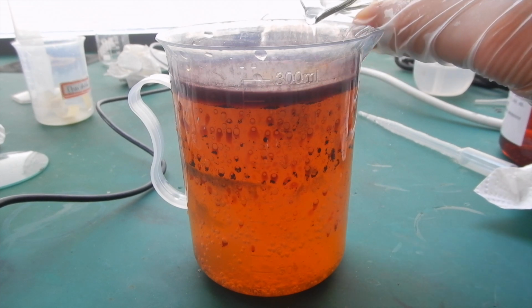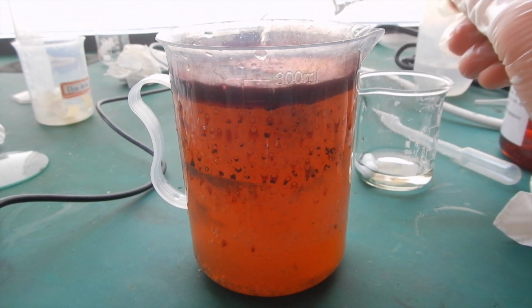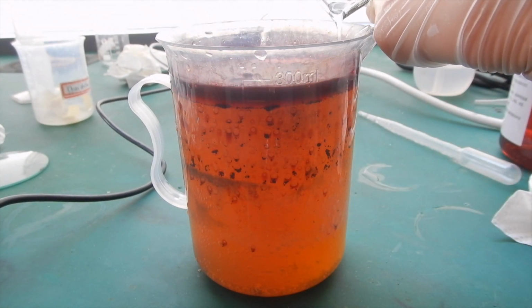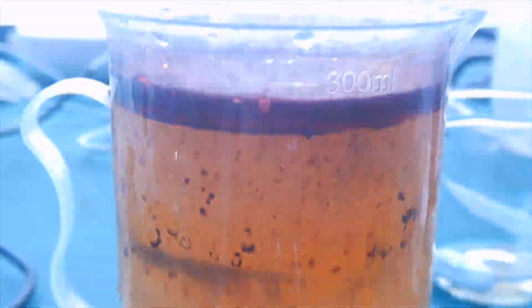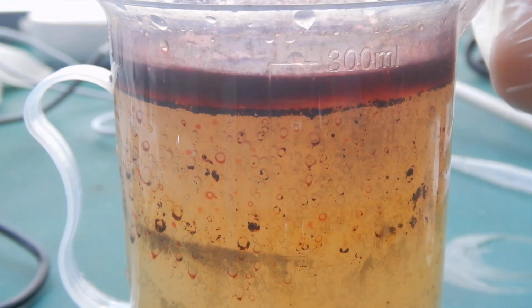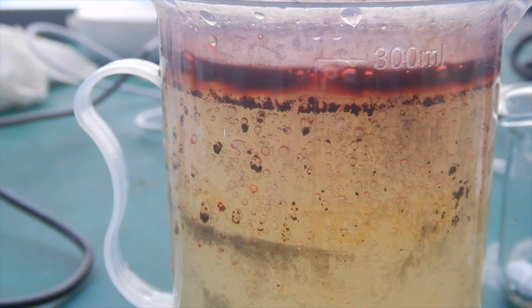After all the potassium carbonate is added in, the color of the solution darkened. I did not expect this at all, because the potassium carbonate is supposed to remove the remaining iodine colors and turn the solution colorless. However, when the solution is stirred, the water layer slowly turns from dark orange to light yellow. I found the process quite beautiful when looking down from the top.